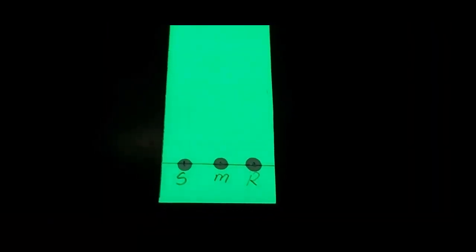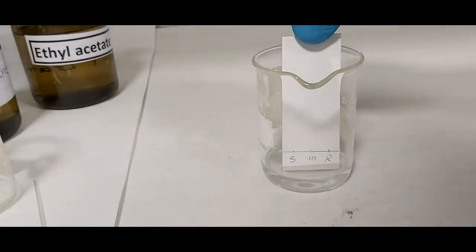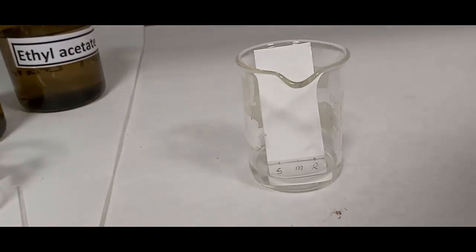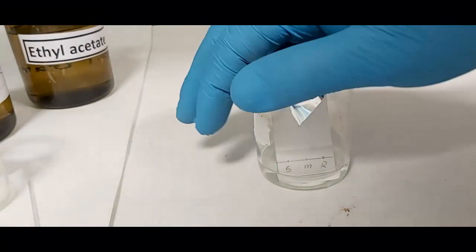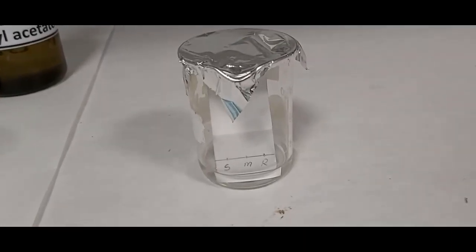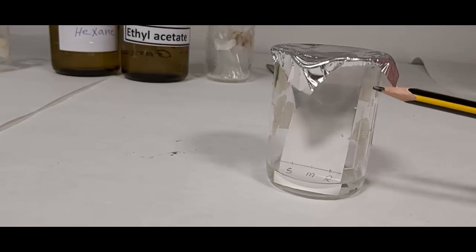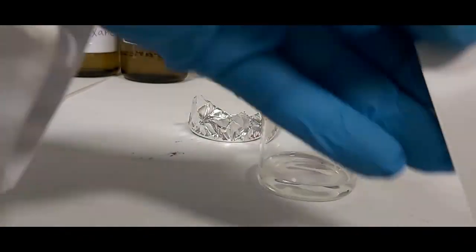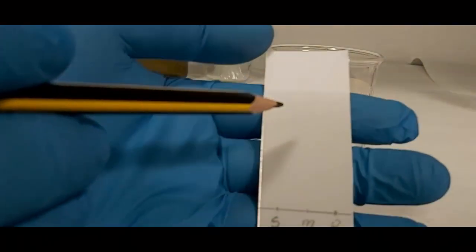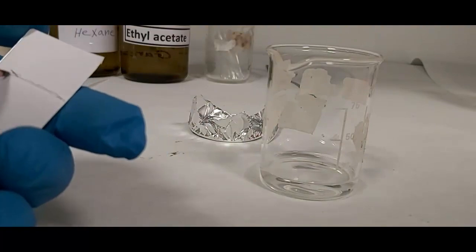The drops look excellent. I place the TLC plate carefully inside the developing chamber and close it with aluminum foil to avoid evaporation of the solvent. After waiting about five minutes, the solvent front has reached the top. I remove the TLC and immediately draw the solvent front line — you can see it very clearly.